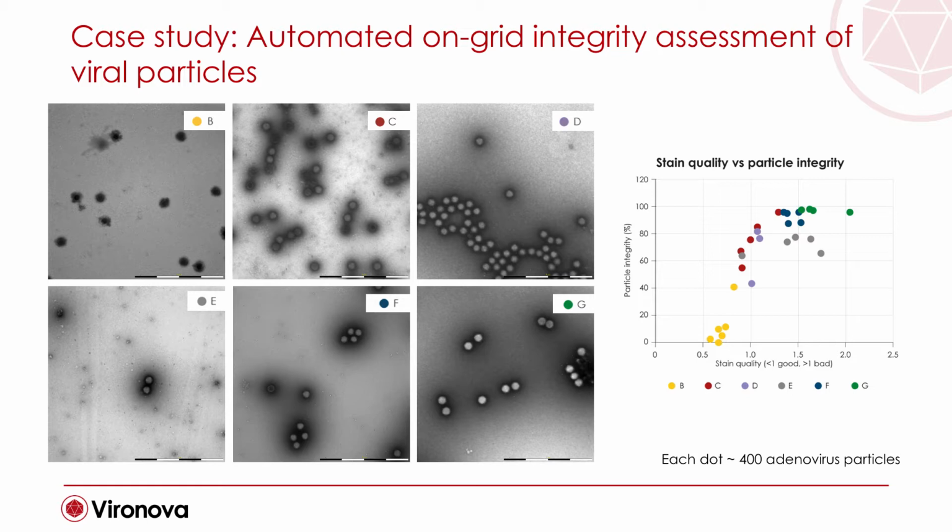And then if we plot this, you can see that depending on the stain quality, which is plotted on the x-axis, so it's a subjective assessment, you can see that particles which are present in B, so which are present in dried out areas, have a really low particle integrity, while the better it goes, the more particle integrity we have.